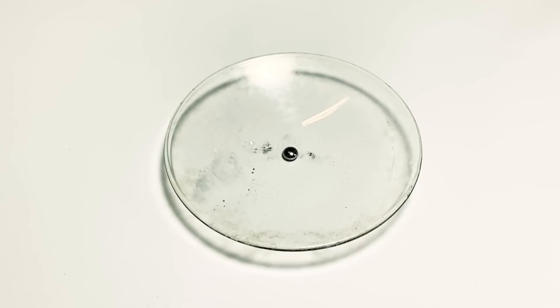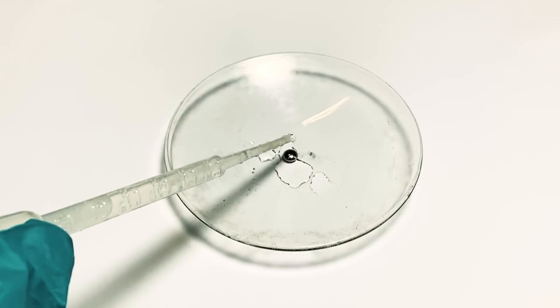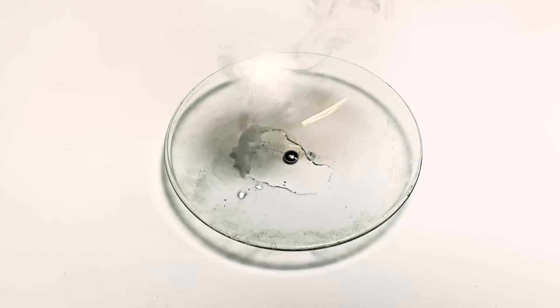Here's some fresh mercury, which I've recovered from the potassium amalgam. And that's the thing about amalgams, if you know what you're doing, then you can probably recover the mercury. And then I've added some concentrated ammonia solution. Then I've added some hydrochloric acid, and here I was expecting it to puff up and become a sponge. But to my confusion, nothing happened.